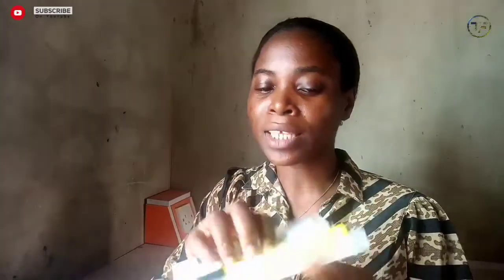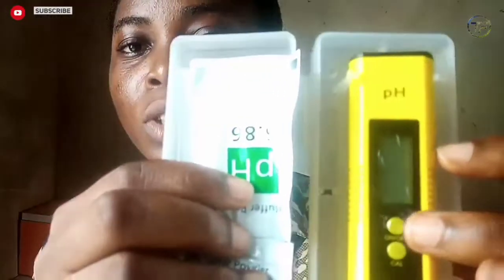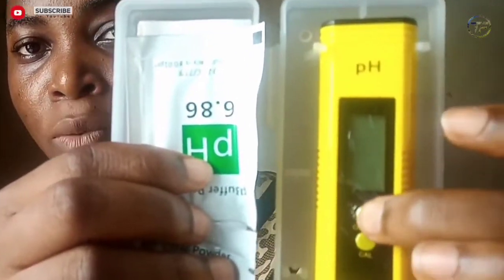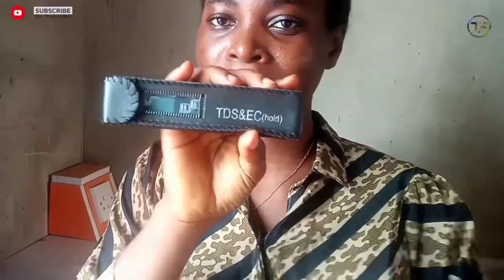I'm going to go straight to the point. With me here I have my pH meter — this is the pH meter. It comes in a pack like this. This one only measures the pH; there are some that come with a thermometer, but this one is just for pH. It has an on and off button here, so you just press it on, and then you can switch it off as well.